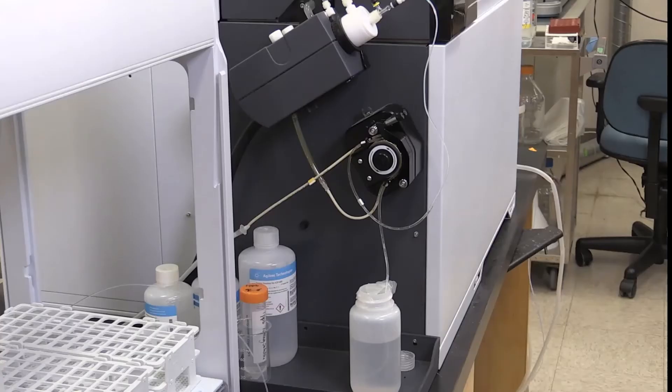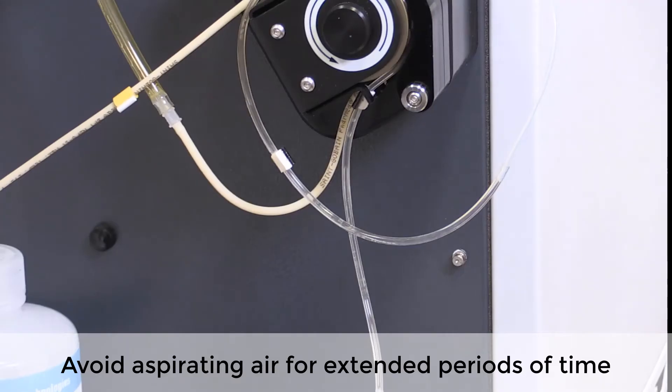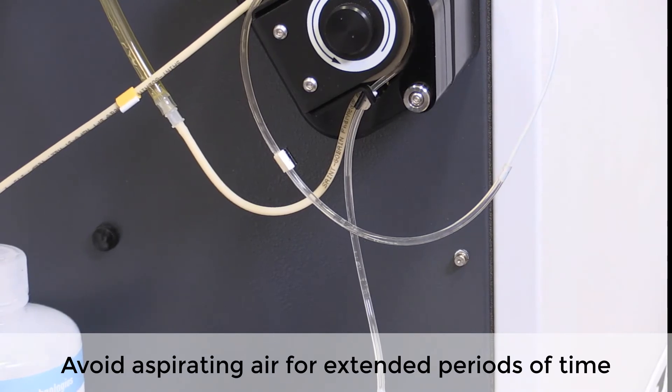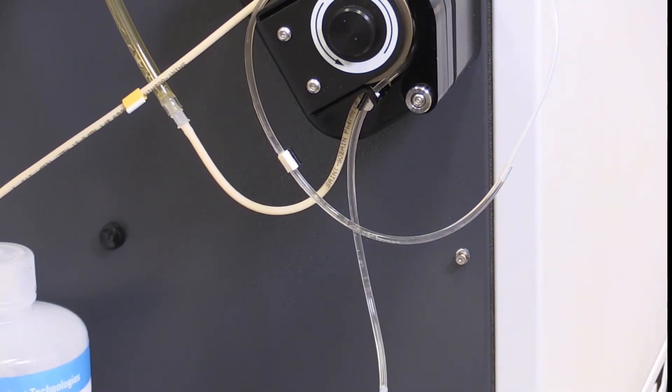We are now ready to turn on the ICP. The tube is placed into the sample solution and moving bubbles can be used to monitor uptake. Make sure all bubbles are removed before analysis.